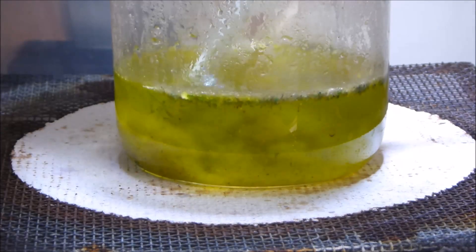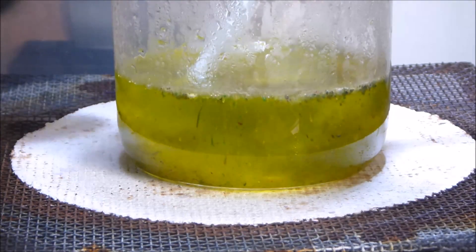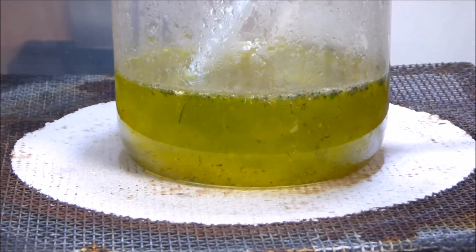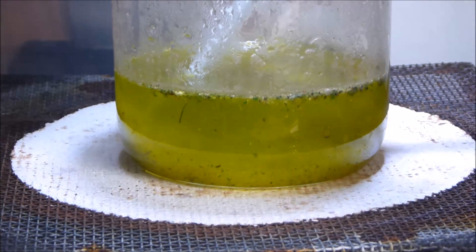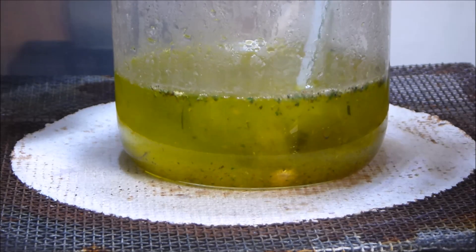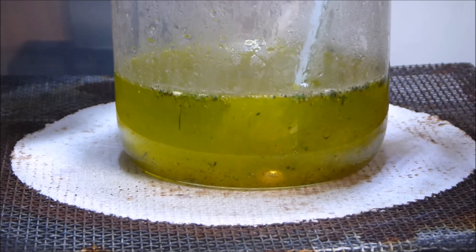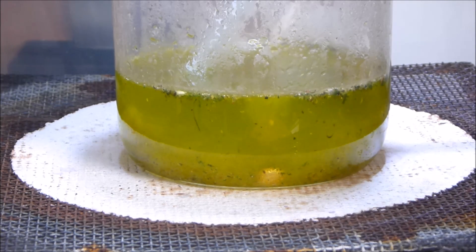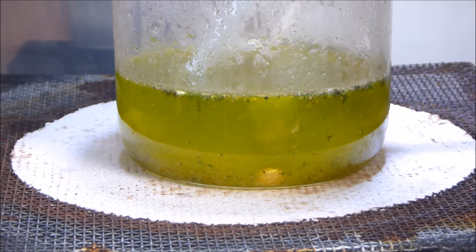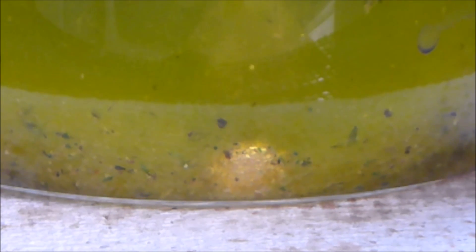What you want is a gold button. This is a 24-karat button that I've dropped out — a few grams. We're just going to drop it in. Obviously you want to weigh your button first. Drop it in gently, and turn on the extraction. Drop it gently because you don't want to damage your glassware — I have broken glassware by dropping gold in too fast because it's so dense. Move it right up to the glass there.